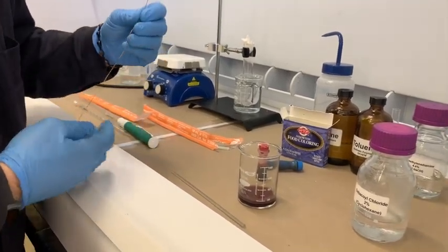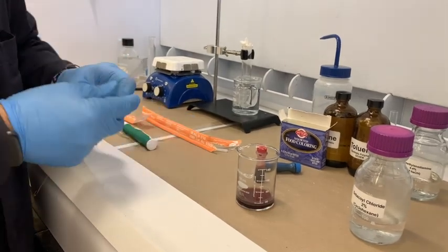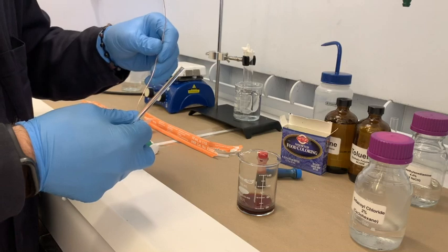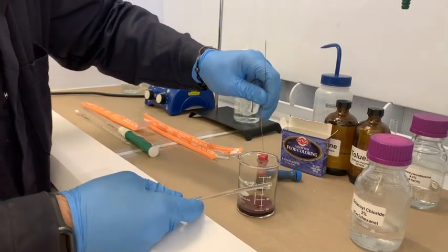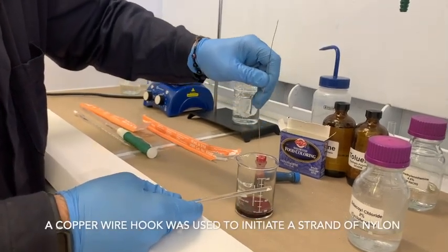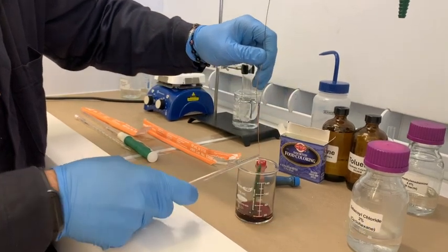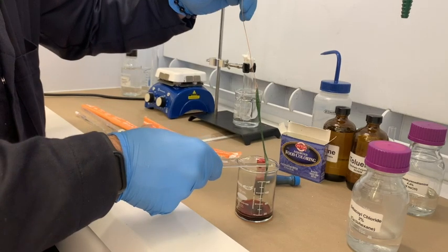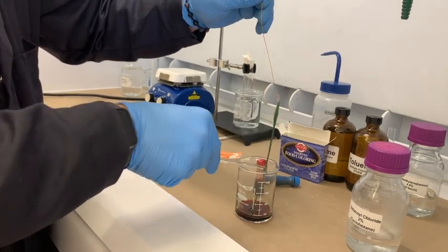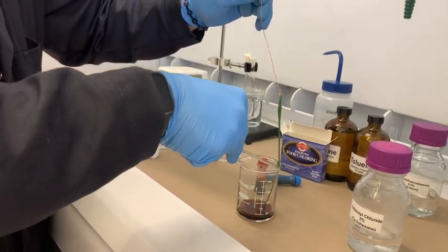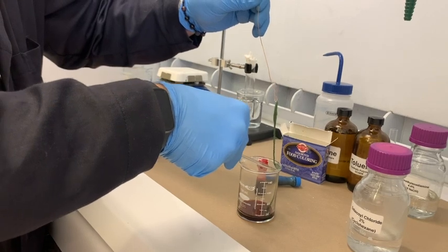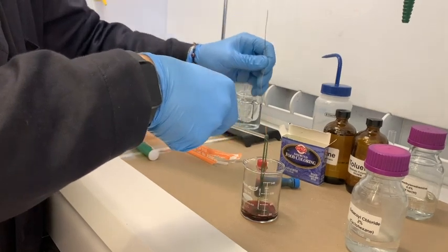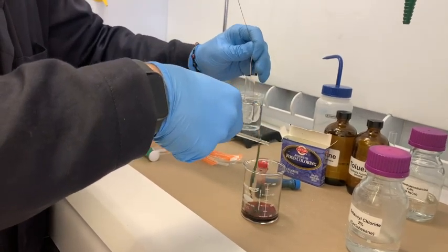So let's see that in practice. I'm going to use this glass stir rod to collect the nylon as it is raised. I'm just going to hook up some of this nylon. Alright. A little bubble there. That's icky. I don't want to take any solution with this. Alright, let's hook it back up here.